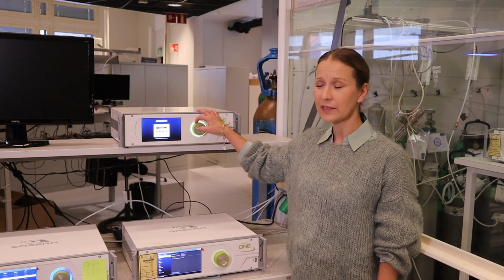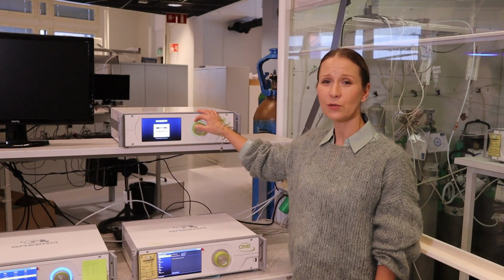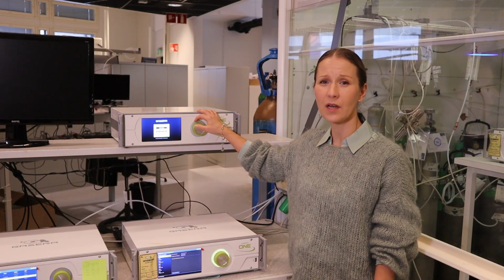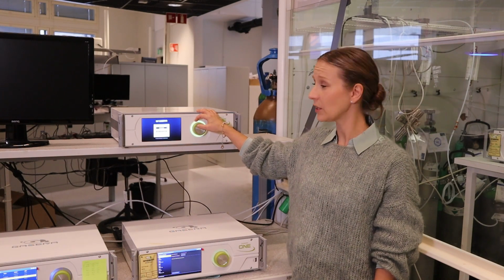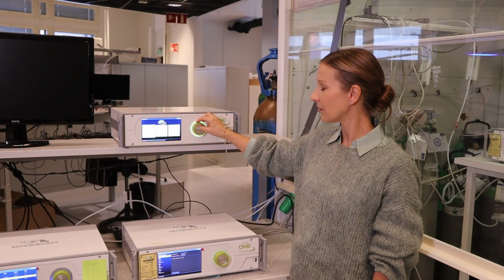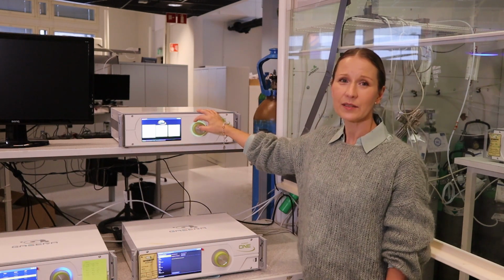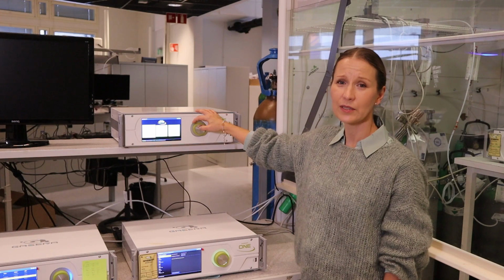From the UI, you can select the user. You can configure different user levels depending on which permissions the user is allowed. Now we are using the administrator level. With the rotating button, you can select the user and password and click in. In the UI, you have three panels: measure, results and setup.